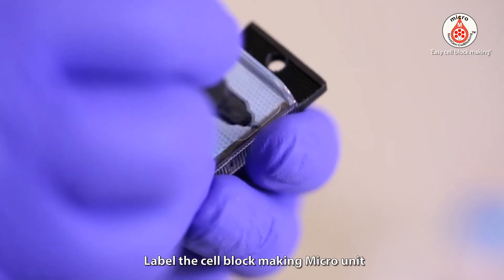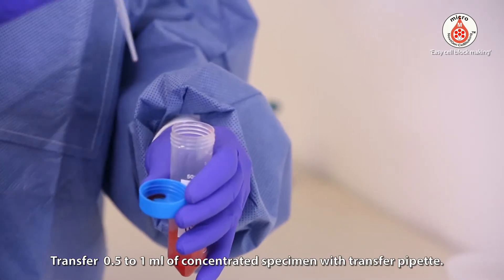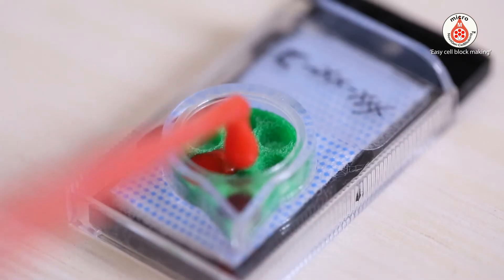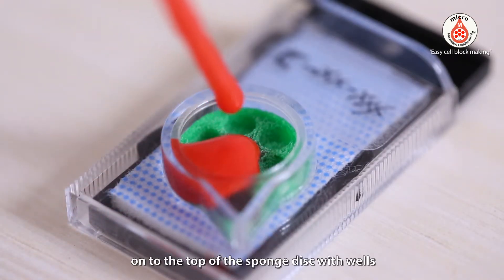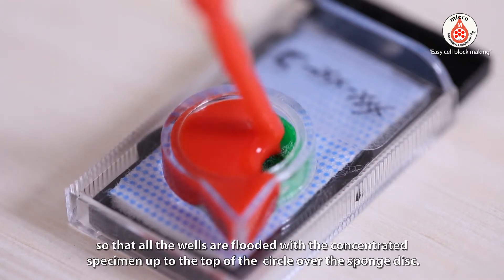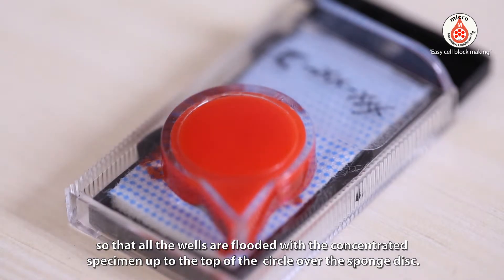Label the cell block making micro-unit. Transfer 0.5 to 1 ml of concentrated specimen with a transfer pipette onto the top of the sponge disc with wells, so that all the wells are flooded with the concentrated specimen up to the top of the circle over the sponge disc.